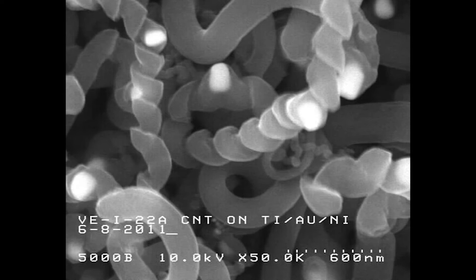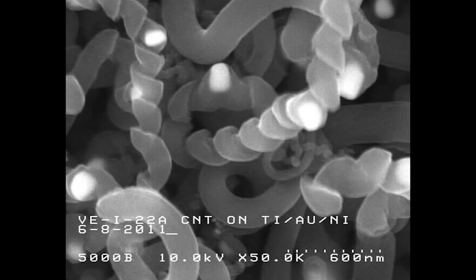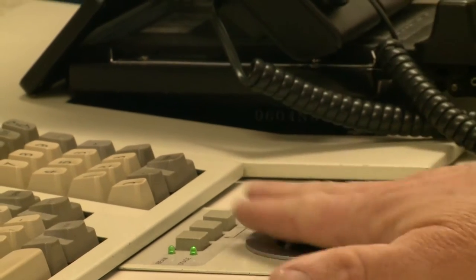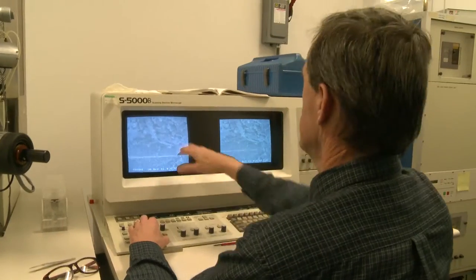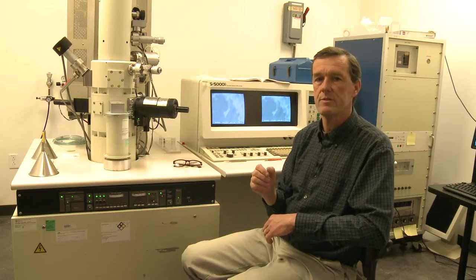Right now I'm going to be accelerating the electron beam at 10 kilovolts, to the point where it has an energy greater than the energies of visible light. And so we're able to image samples that have features that are smaller than a wavelength of visible light.